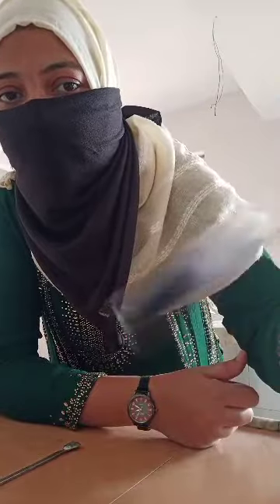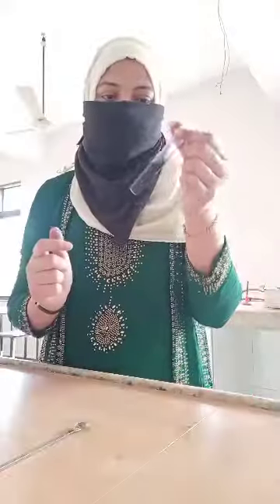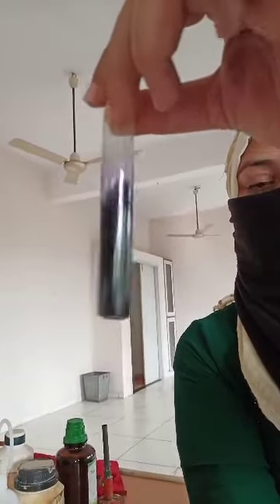Dear students, I started getting the purple color. This purple color indicates the presence of phenol. It is not the black color — it is the purple color. So purple color solution, a very dark color solution, indicates the presence of your phenol. When I am shaking, you are able to see the blue color on the topmost. So this shows the presence of your phenol.